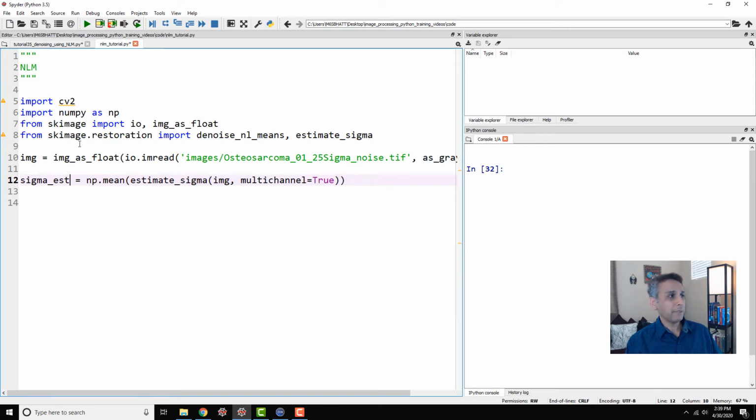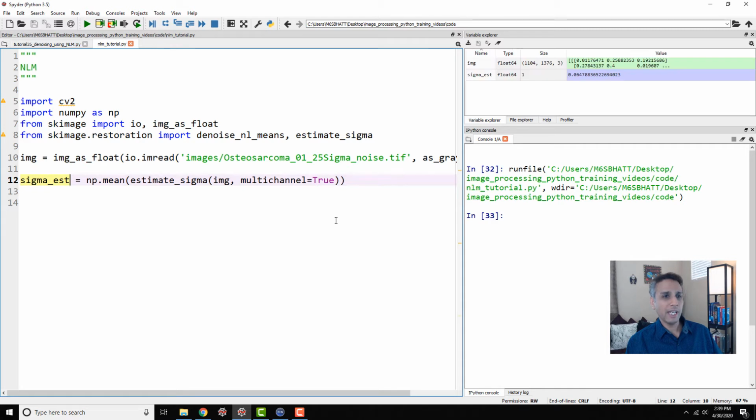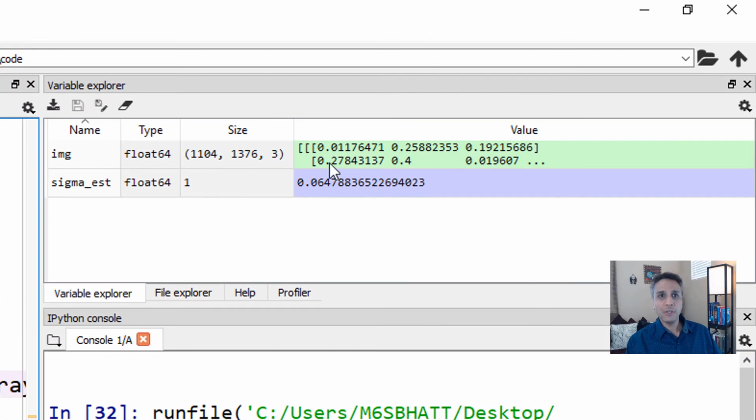So my sigma estimate, let's run the code up to this point and have a look at the numbers up here. So my image, again, because I'm using img_as_float and io.imread here, the image is going to be floating point numbers with values ranging between 0 and 1, okay?